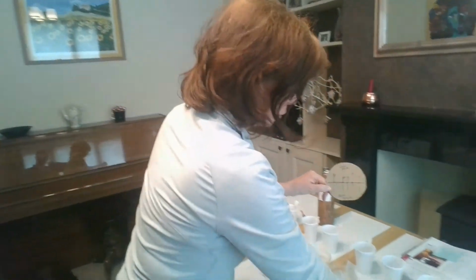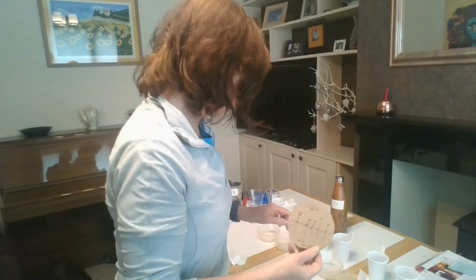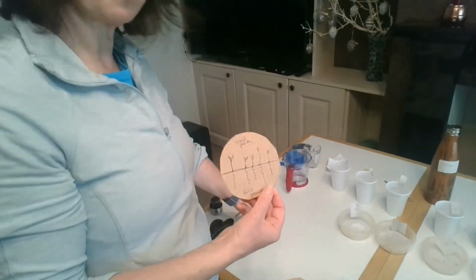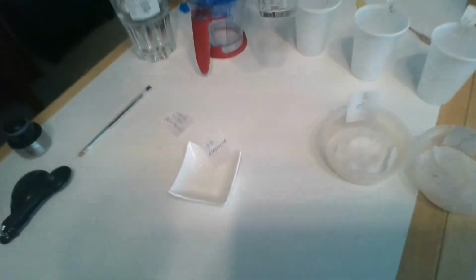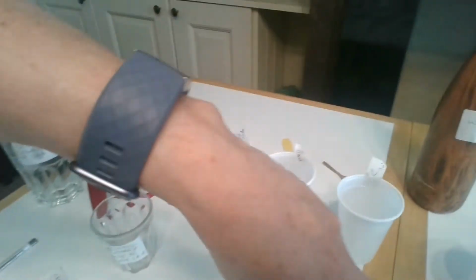Now, all of this is way too much detail for your exam, and you won't need all of this for the exam. It's just so that you will understand what we're actually doing here. So we're doing a serial dilution. You've got to know that your seeds are our plant tissue. You've got to know about your IAA and dissolving it in ethanol or alcohol. You've got to describe as best you can your serial dilution.